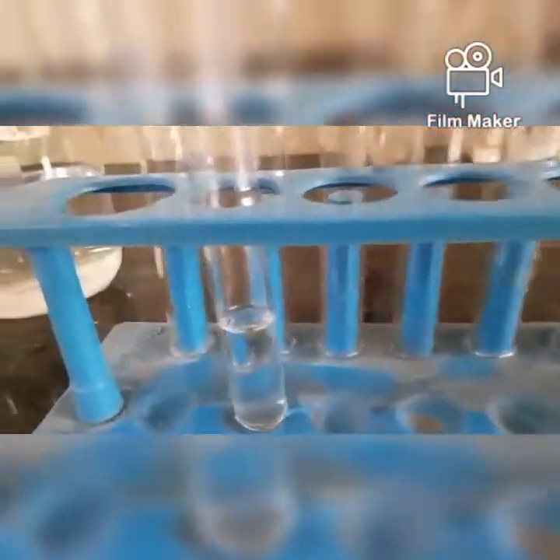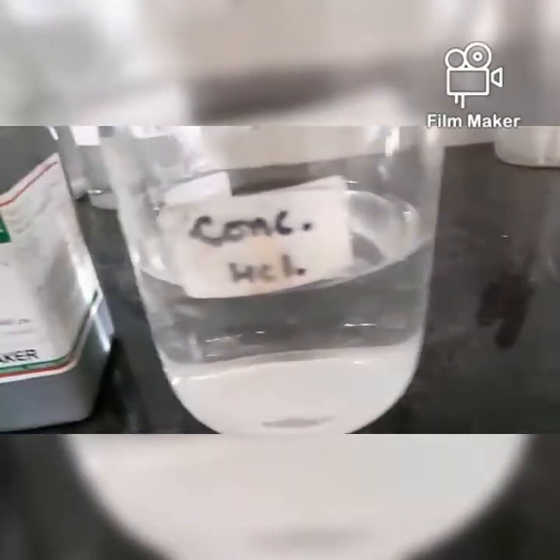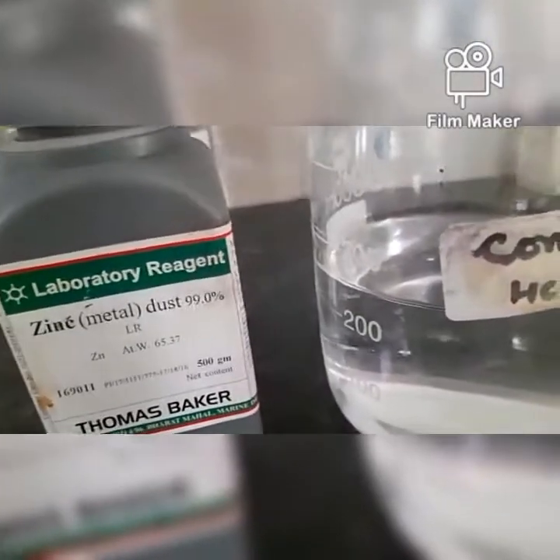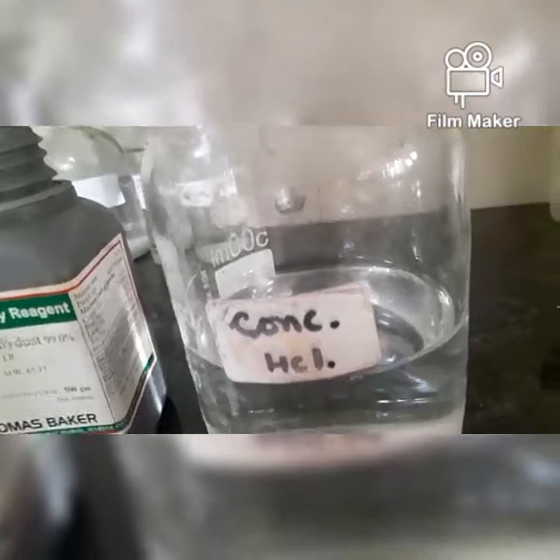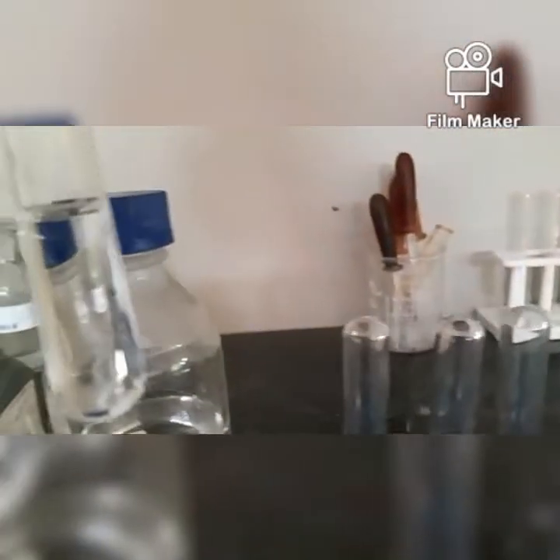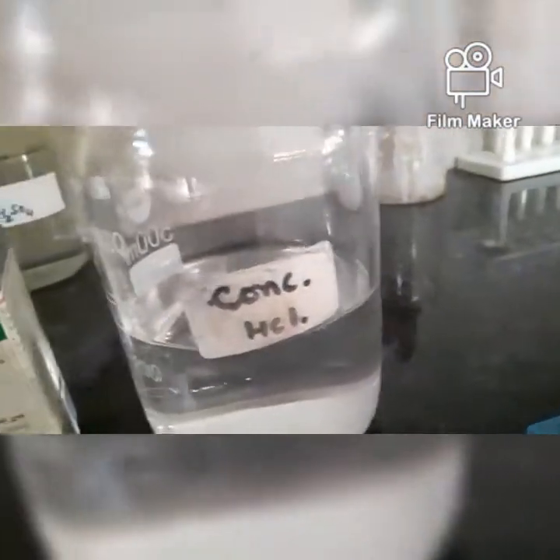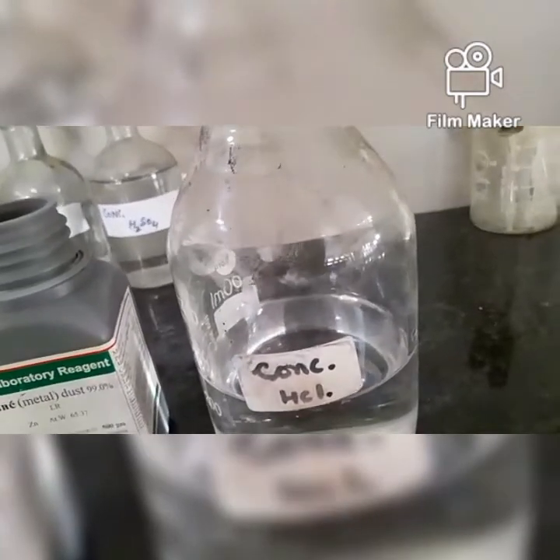We are going to do our first experiment with concentrated HCl and a metal. That is your first reaction, the first equation that is given to you, the reaction of metals with acids. So I have taken some amount of HCl in the test tube. Now I am going to add the zinc dust. Zinc dust is actually the zinc powder. Okay, so I'm going to add it into the test tube and let's see what's going to happen now.